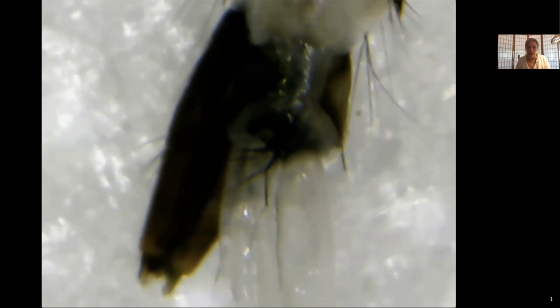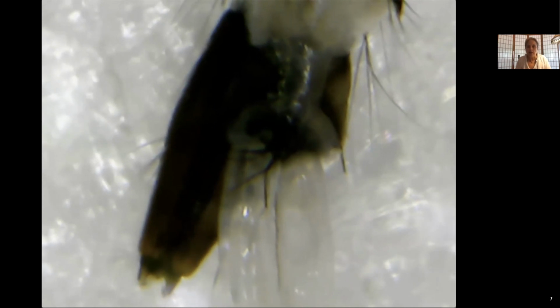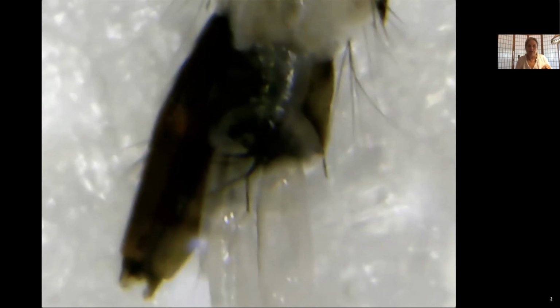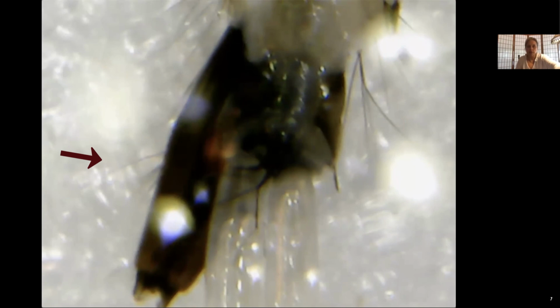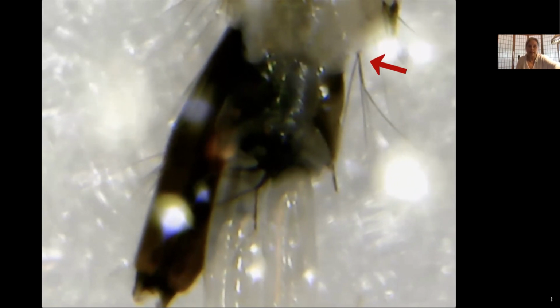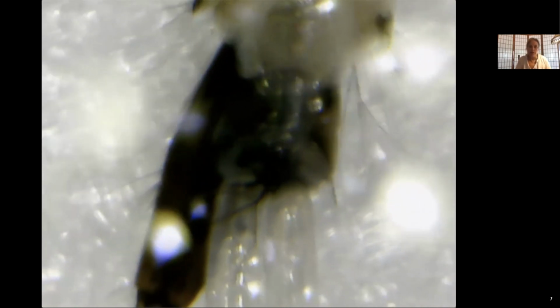The first thing that I can show you, I'm looking for pecten, but in this orientation, I don't see it. But on the left of the siphon, you're going to see some hairs coming out. It's multiple hairs. There is one hair, and then there's a tuft of hairs, which you can call setae if you want. There's another hair right there. So there's at least 3 or 4 hairs. There's another hair towards the base there. And we also can see, I'm sorry, he's moving just a little bit too fast.